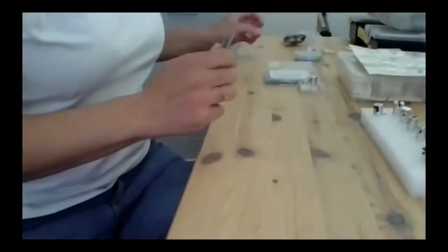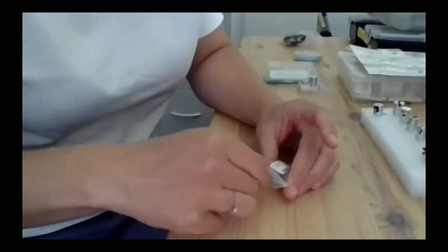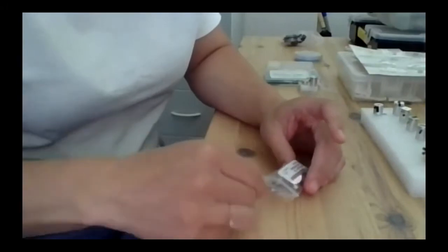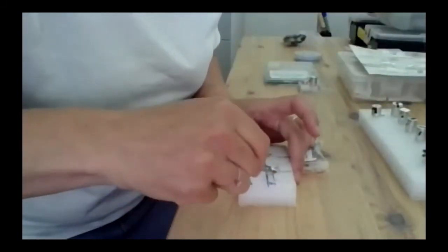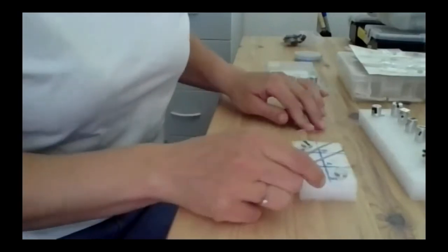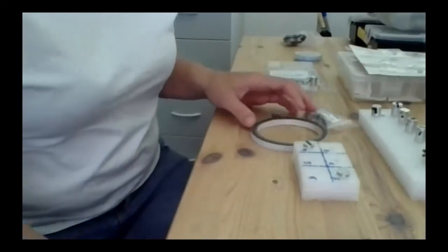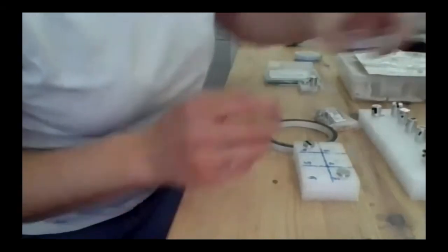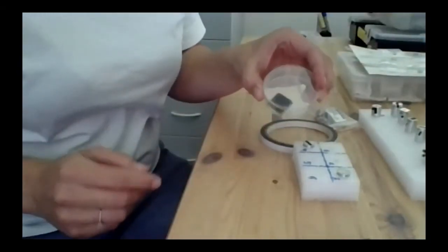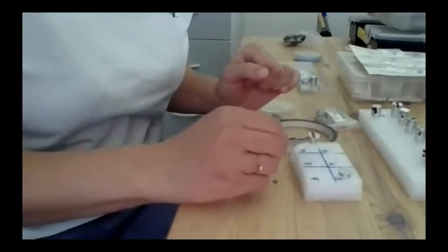So here I have a holder, it's a traditional pin. And you just place a pin and mount your sample there with carbon tape. So, for example, I will take something which is really big so that you can see it. I have already carbon taped here.